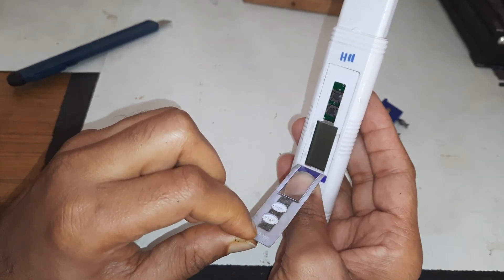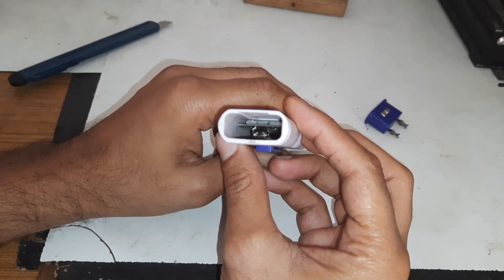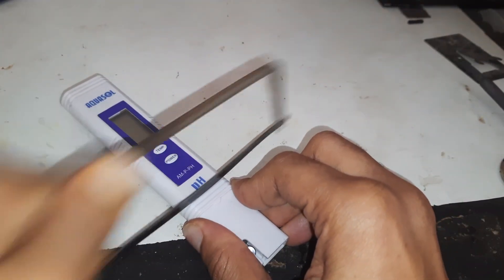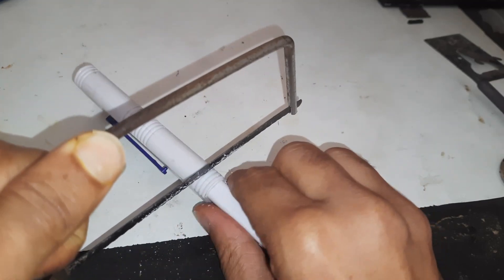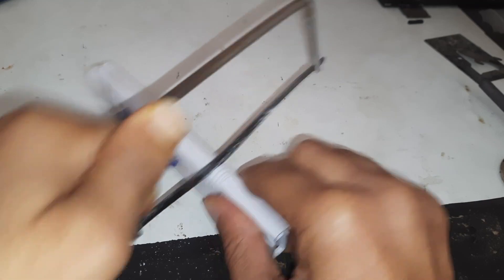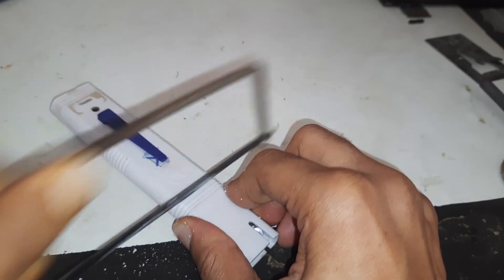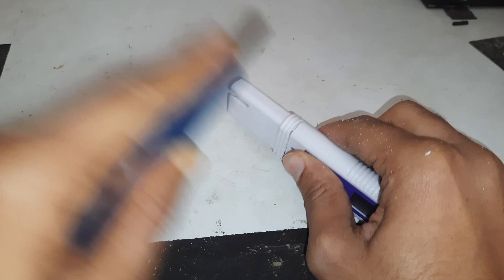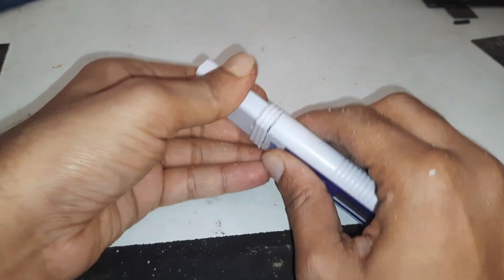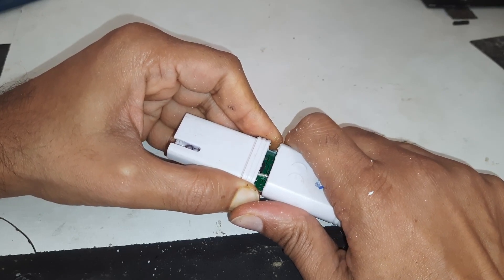Maybe there is a screw under this label. It has only two switches inside. In fact, these meters are not made to repair, so breaking it is the only option to see inside. I'll try not to damage the parts so that I can put things back for further use, but it's still stuck inside.